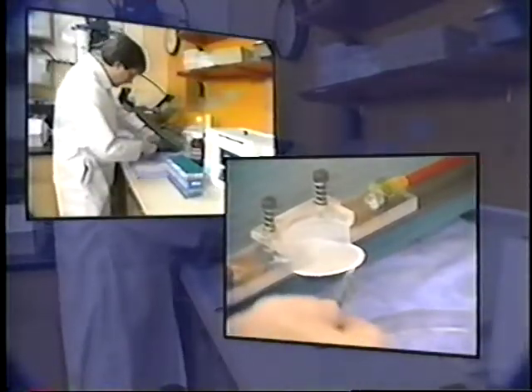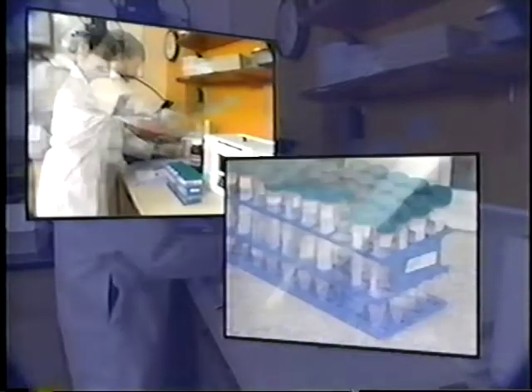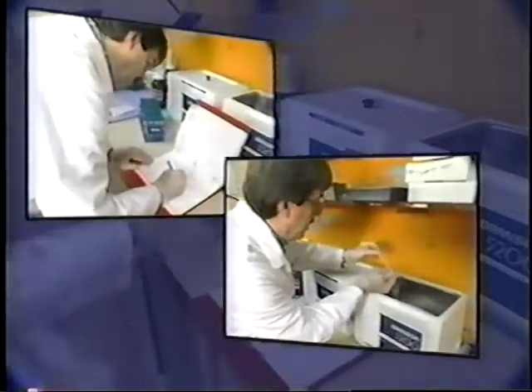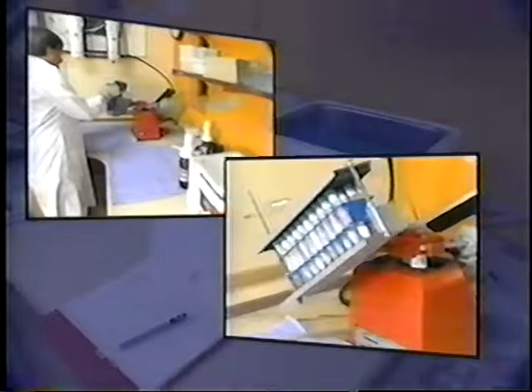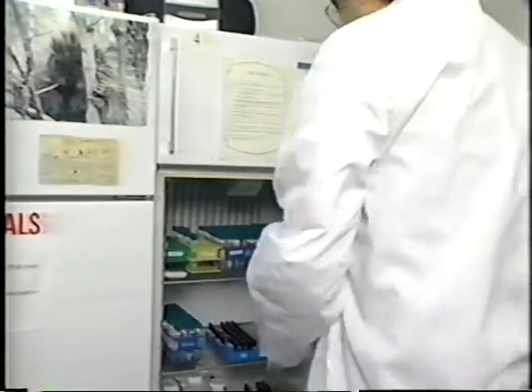All ion analysis methods require a fraction of the filter to be sectioned, extracted in deionized water, and then filtered to remove insoluble residues. 40 to 50 filters are placed into an extraction rack, sonicated for a minimum of 60 minutes at stable low temperature, and then mechanically shaken for 60 minutes. The extracted samples need to be stored in a refrigerator overnight prior to ion analysis.